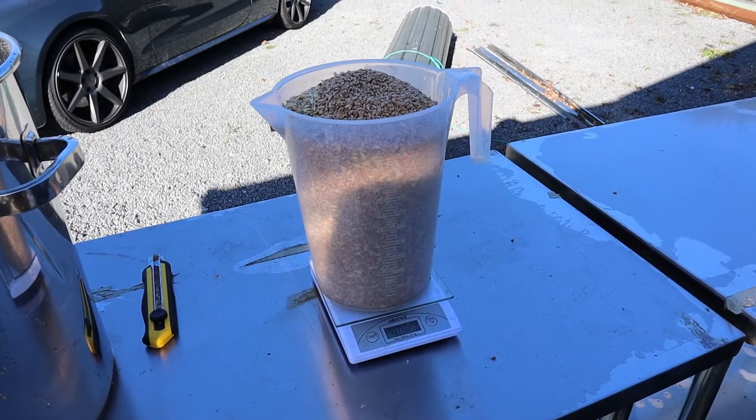It's not like an American-made pressure cooker — it's a cheaper one, the only ones we can really get in New Zealand. Because it doesn't get up to that high pressure, I have to sterilize for a lot longer, in the range of two hours, and it just wasn't doing the trick. So I've made my own way, which works really well for me. It's a mixture of both: it involves cleaning the grain first, getting it nice and clean, then adding a predetermined amount of water and sterilizing from there.